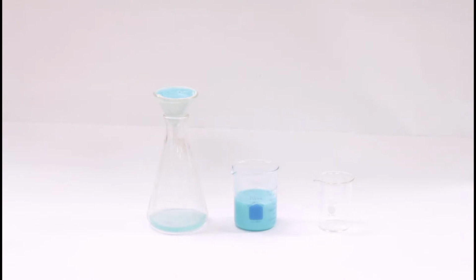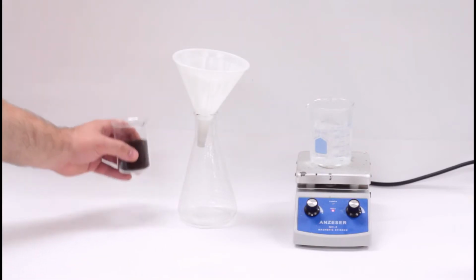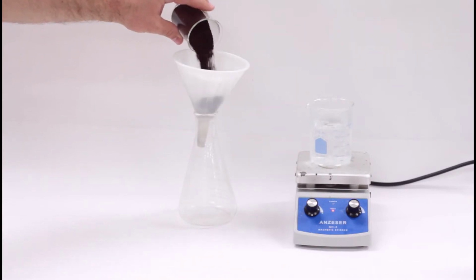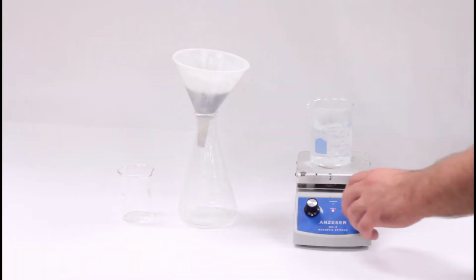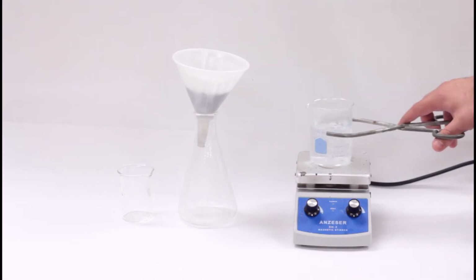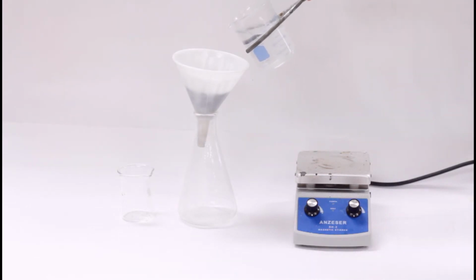The basic method of separating a liquid solution from a solid is gravity filtration. This is what happens when you make coffee. A suspension of water and coffee grounds is made, flavor molecules and caffeine are dissolved in the water, and then the solution of coffee is separated from the used grounds by a coffee filter. The solution falls through the filter due to gravity, hence gravity filtration.